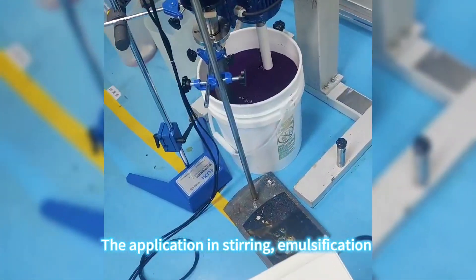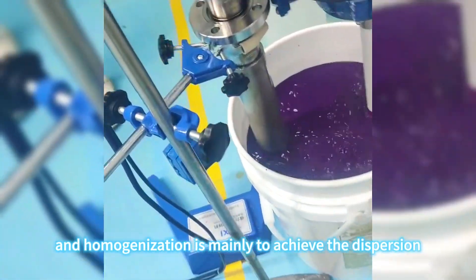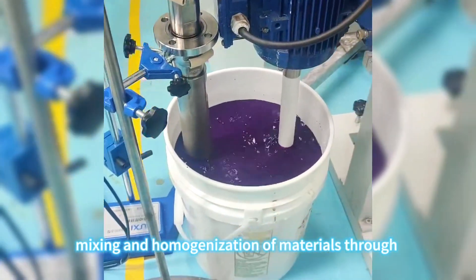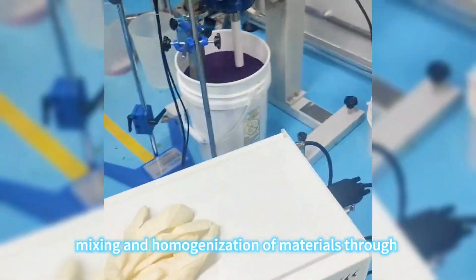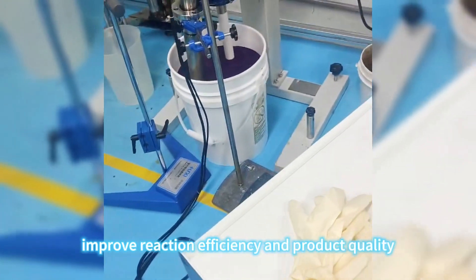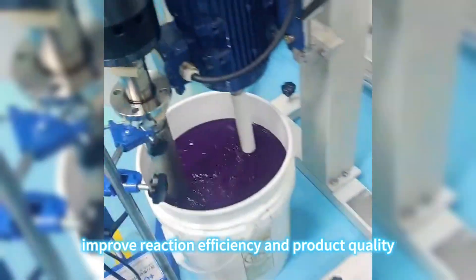The application in stirring, emulsification and homogenization is mainly to achieve the dispersion, mixing and homogenization of materials through the mechanical action of ultrasonic waves, to improve reaction efficiency and product quality.